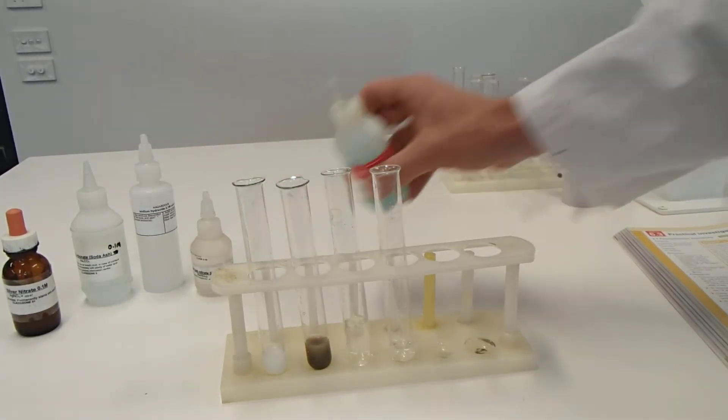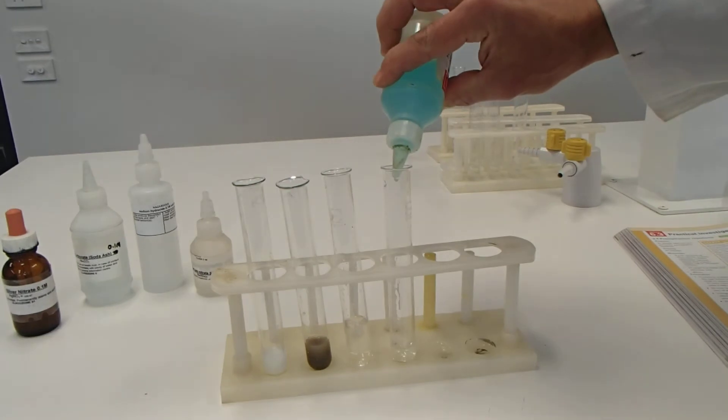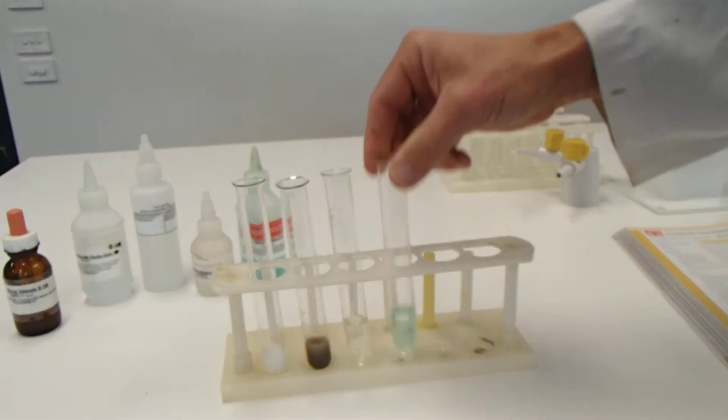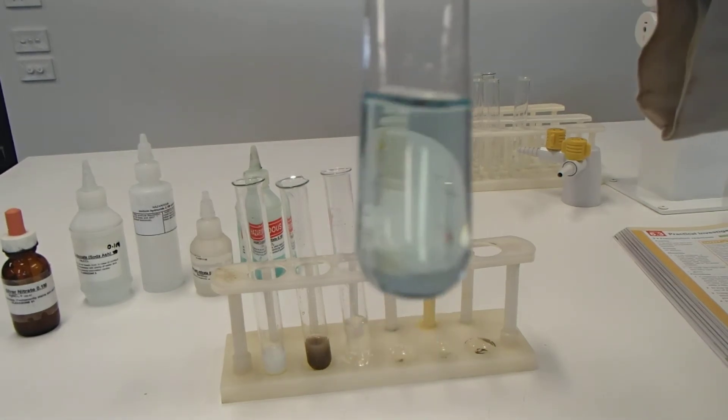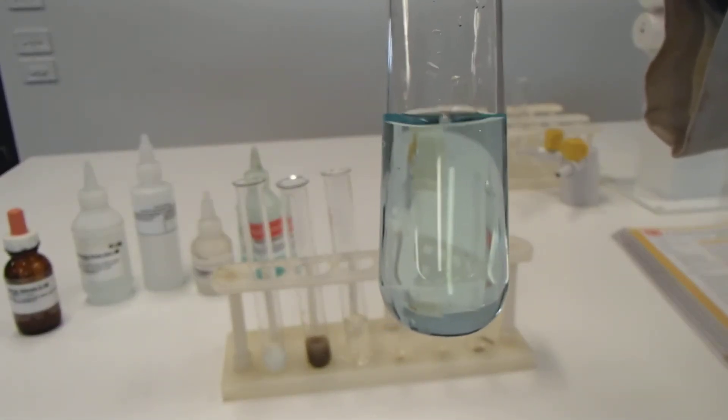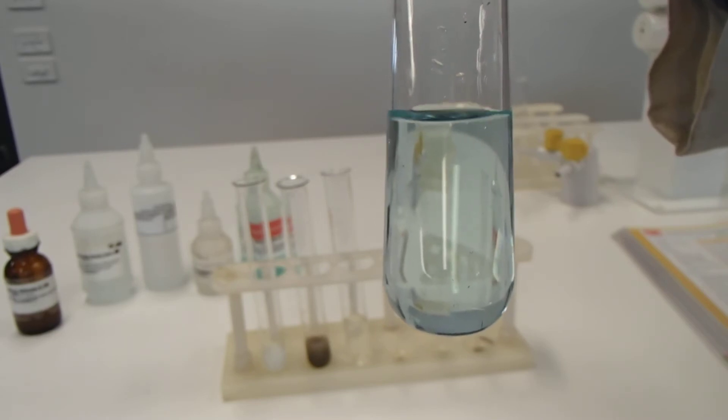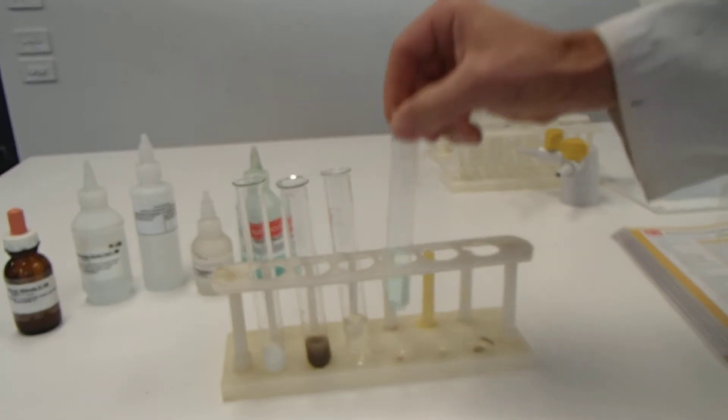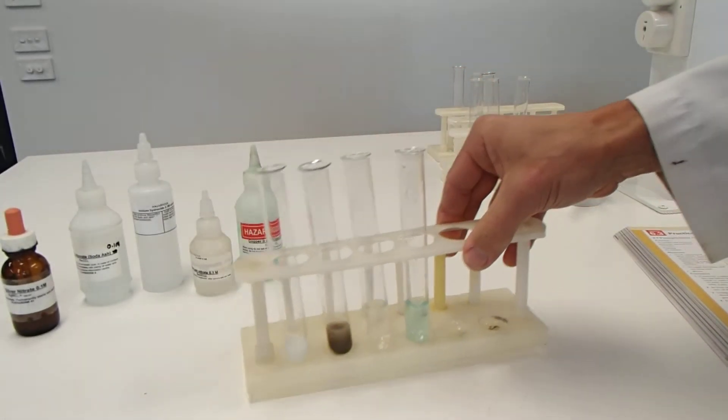And last of all, we have silver nitrate with copper sulphate. Put a bit of that in. Copper sulphate. And we can see that that is as clear as day. It's blue, but the copper sulphate was already blue. So clear as day. I can see straight through that. Okay, so I'm putting that one to the side now.